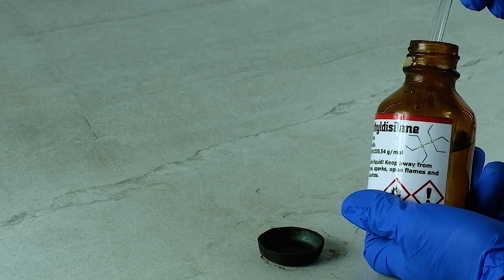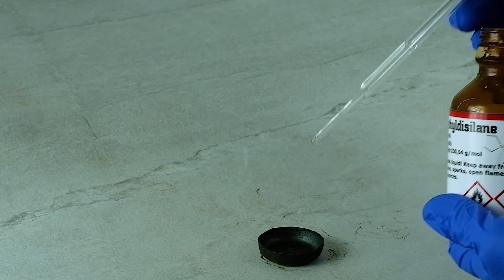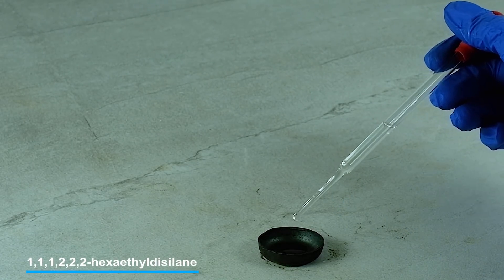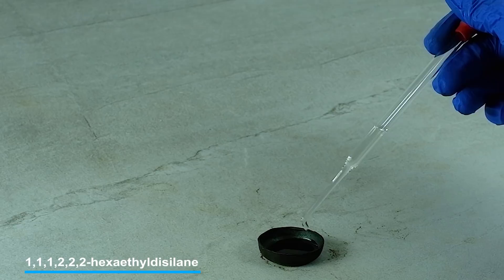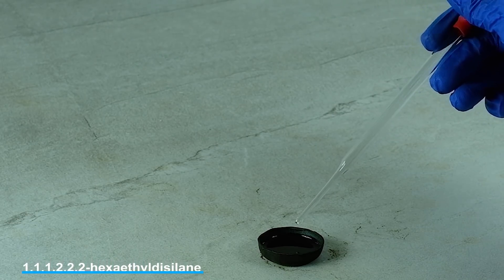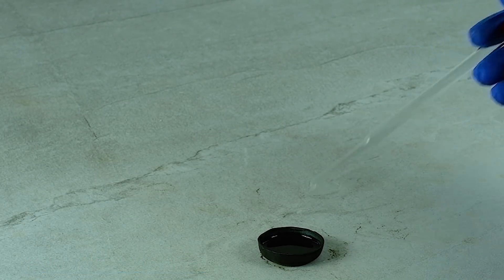For this reaction I decided to use an organosilicon compound. So during burning you can see white soot, which is the end product of organosilicon compounds burning.